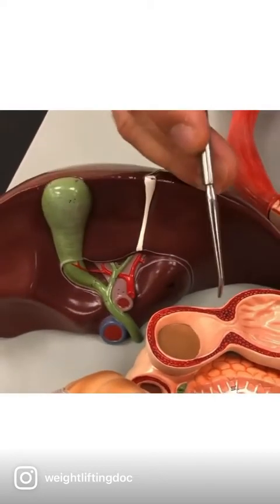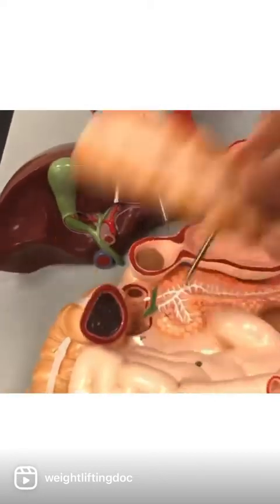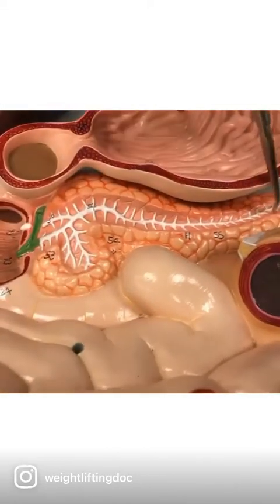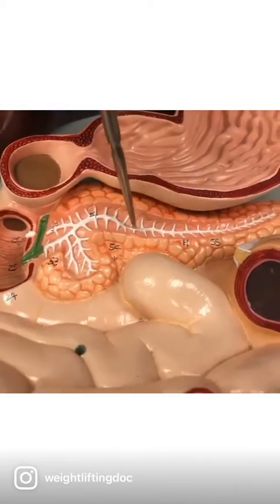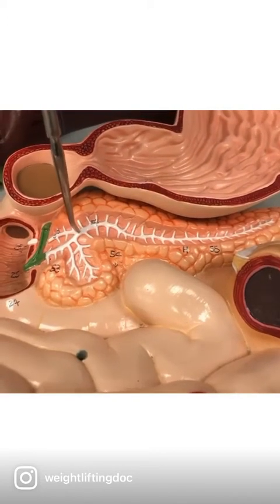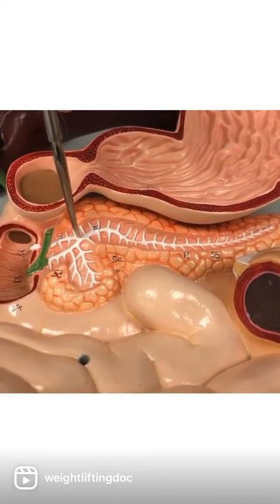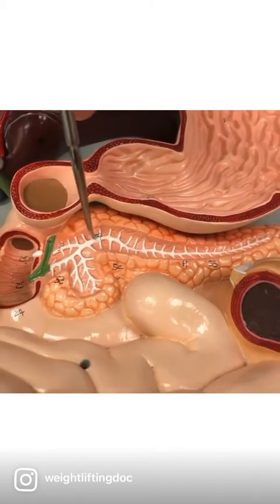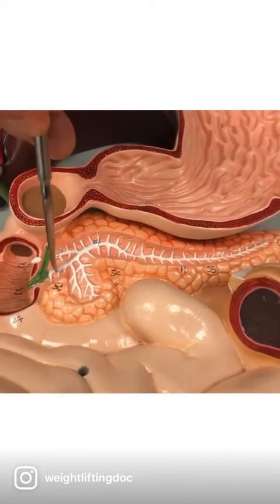Actually, let me pull this off. We'll look at the pancreas too because we want to cover that while we're here. This is the pancreas. This is the main pancreatic duct here. And then we split right there, and we're going to get a different name. The one that goes a little bit up or straight across is called the accessory pancreatic duct. The one that goes down is still the main pancreatic duct.